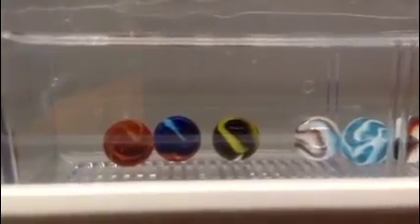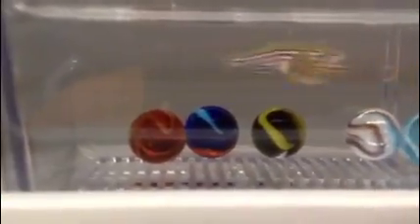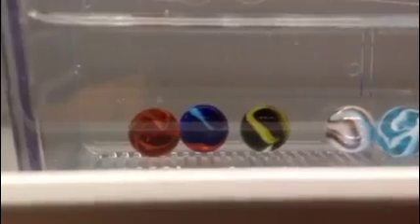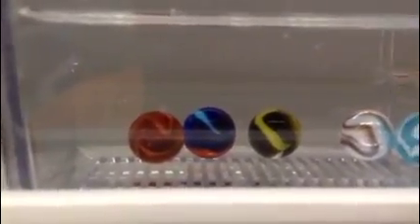How do we get the embryos? Well, zebrafish reproduce relatively quickly. You put a male and a female together in a tank in the afternoon. By the next morning, they will have laid eggs, and those eggs can be easily collected and then studied over the next several days to watch the nervous system develop in real time.